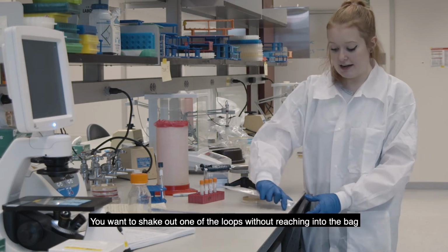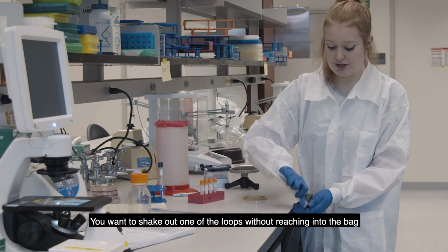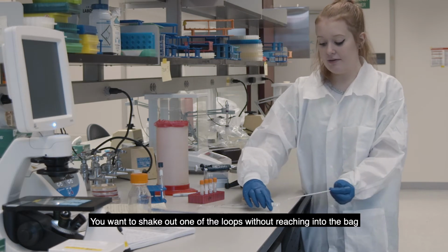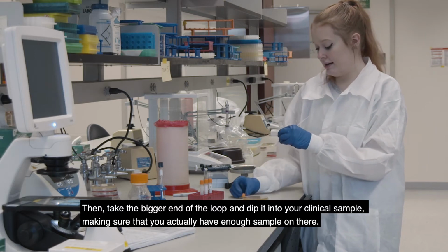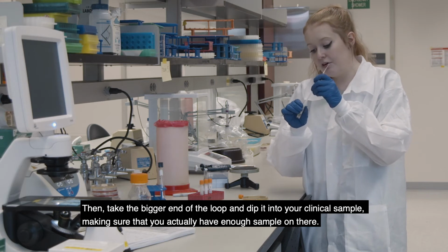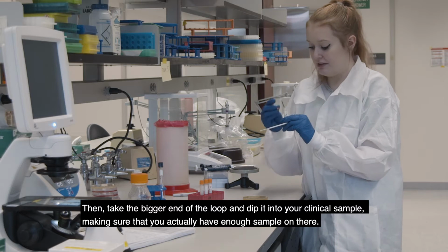You want to shake out one of the loops without reaching into the bag. And then you're going to take the bigger end of the loop and dip it into your clinical sample, making sure that you actually have the sample on there.